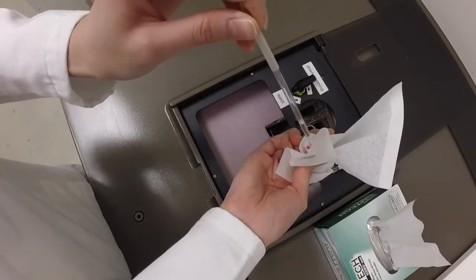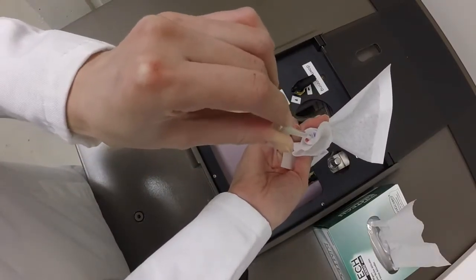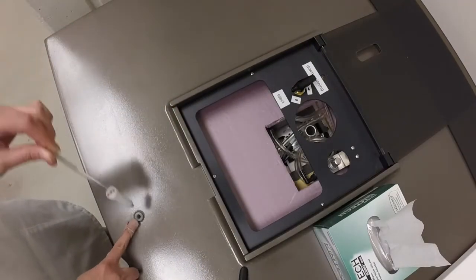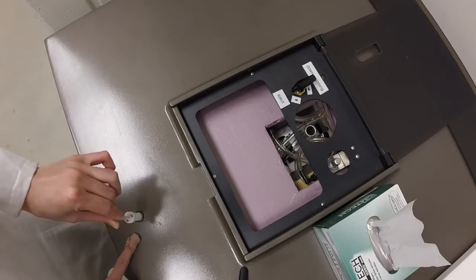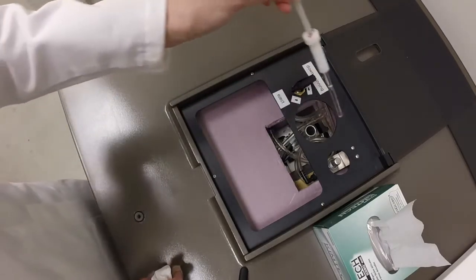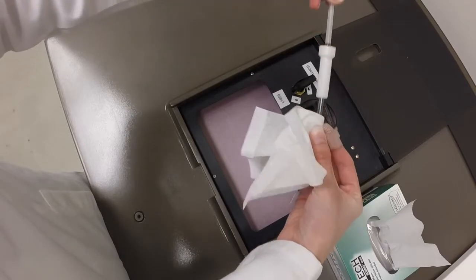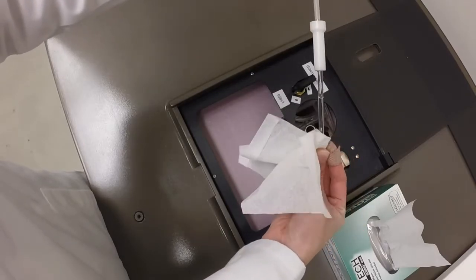We will then put our sample in the spinner and use the spacer to make sure that the spinner is positioned correctly. You'll need to push the NMR tube down into the spacer until it stops, and you don't need to push hard. We will use a Kim wipe to then clean the sides of the NMR tube and then set it inside the NMR.